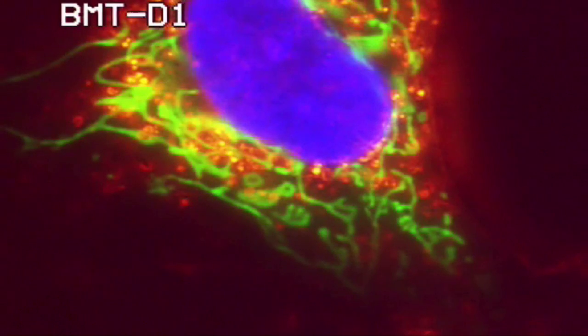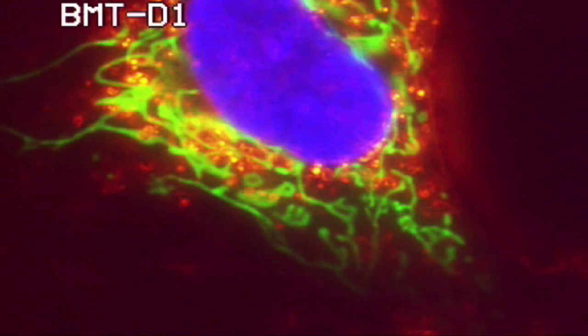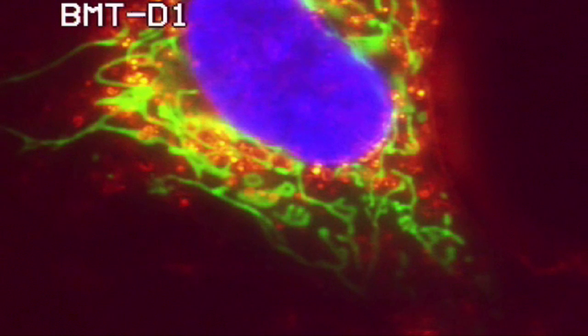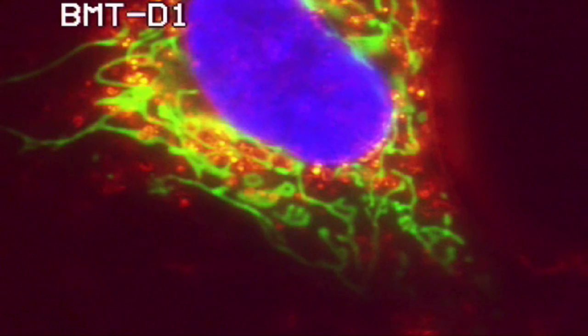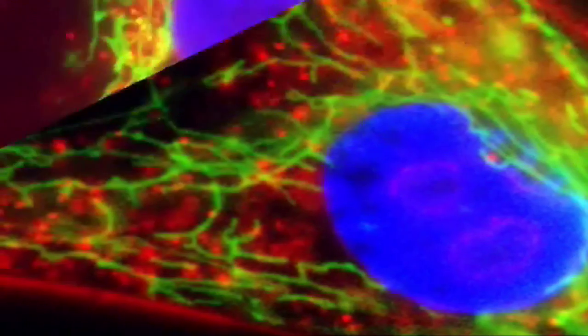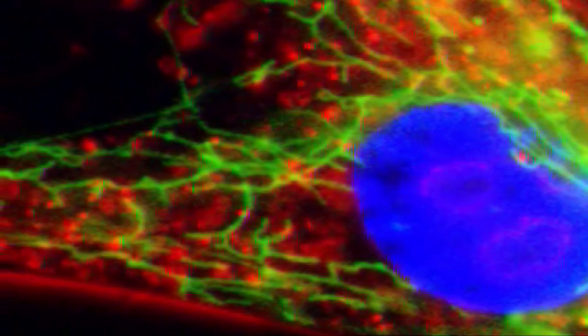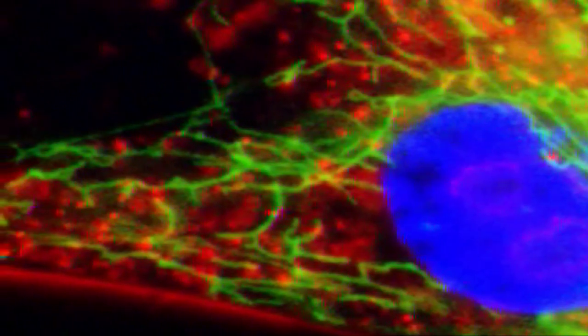With this microscope we can overlay these three stains together and see their relationship to each other. It creates these wonderful images.